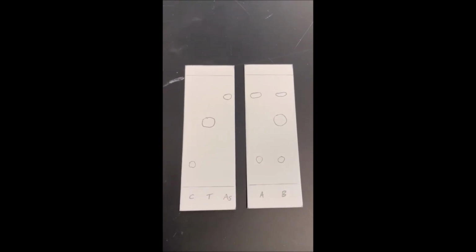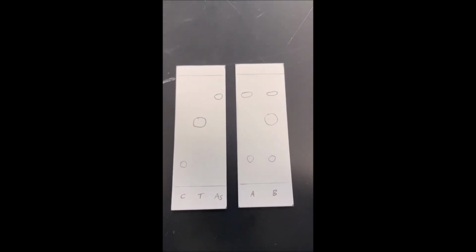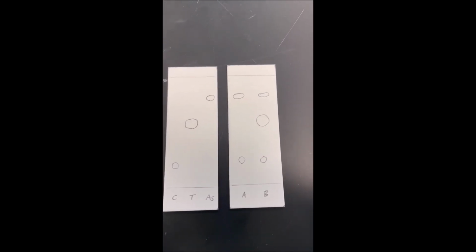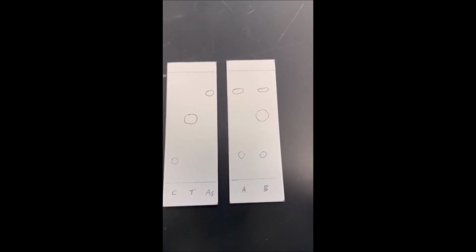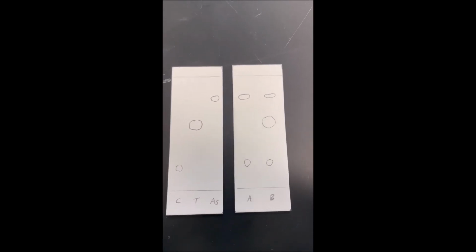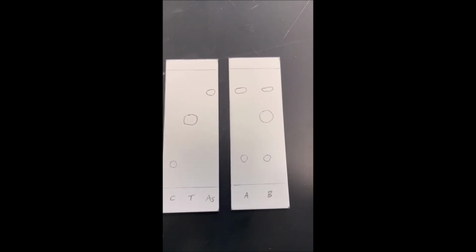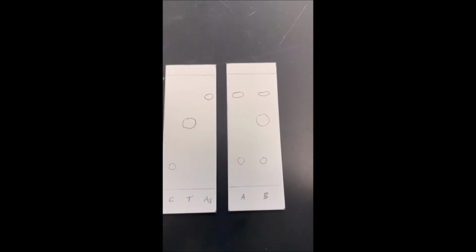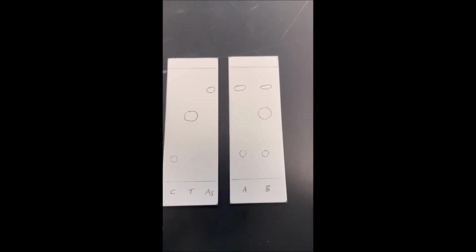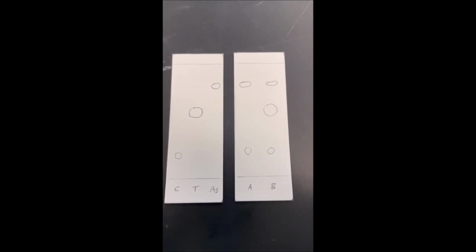Okay guys, so what this video is showing are the 2 TLC plates with the spots marked. I'm sorry that the camera's moving around a little bit. I'm literally holding my phone above these plates. I've marked each of the spots with a circle, okay? What I did was I literally drew a circle around each spot. And so the hope is what you can tell is caffeine, Tylenol, aspirin all move different distances up the TLC plate. And then unknowns A and B, you can tell what's in them. You can see how many spots are in A, you can see how many spots are in B. And hopefully you can tell something about the identity of each spot, all right?